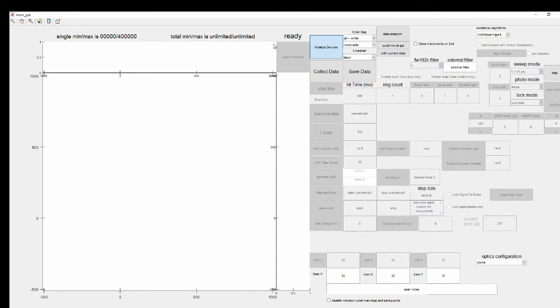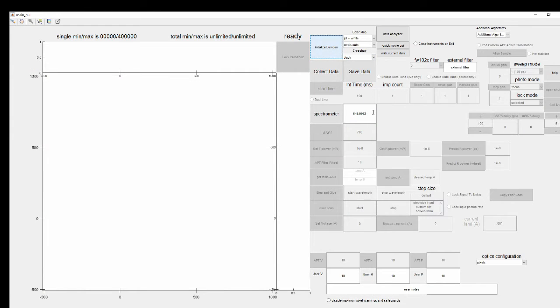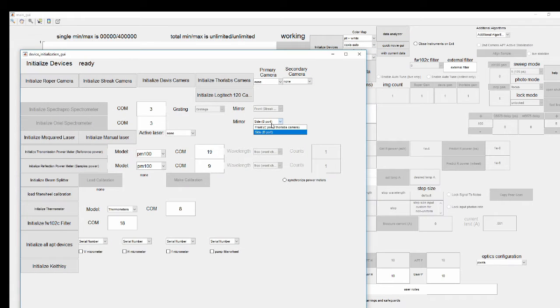Now, in order to do this, we're actually going to do a little trick. So the Oriel is actually already integrated into MATLAB. So for example, if I open up Device Initializer and I turn on the Oriel, I can see that everything there worked fine, and it can function just like a spectrometer. But this is actually more so for the Thor Labs camera imaging, which is on the other output port, the C port on the Oriel spectrometer.